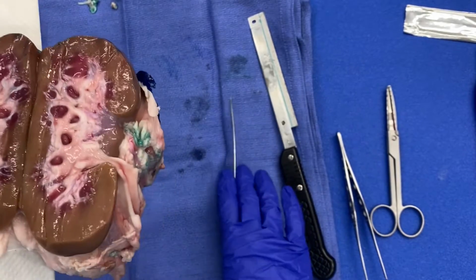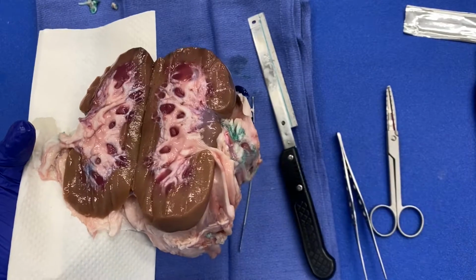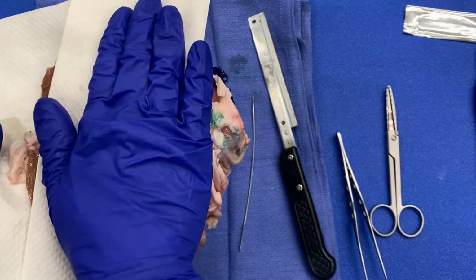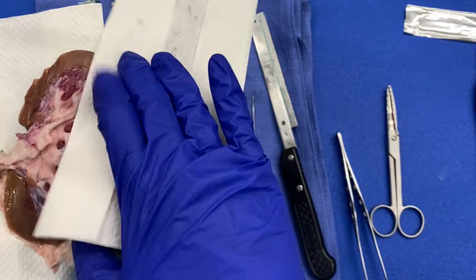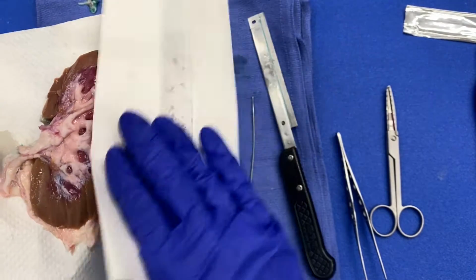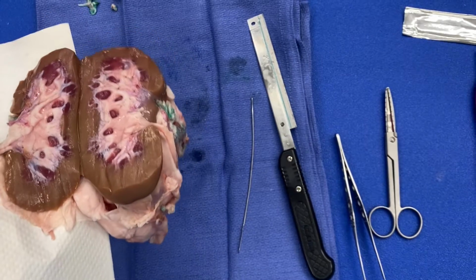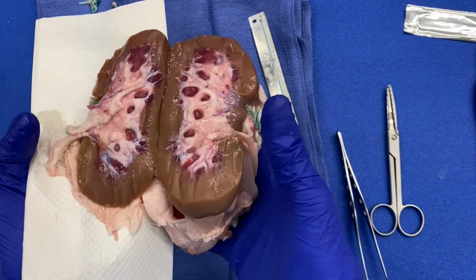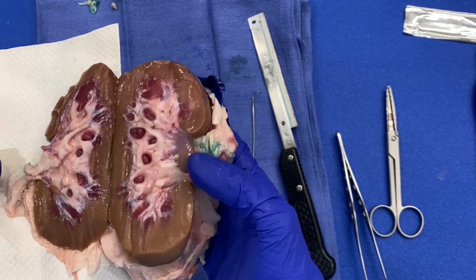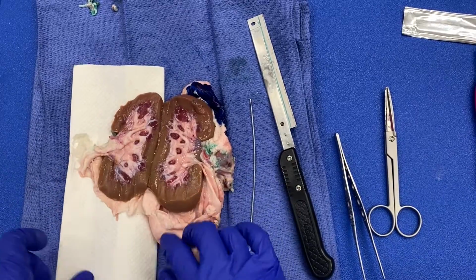Okay, so now at this point, once you've bivalved the kidney, what you can do is measure the kidney in 3 dimensions, because remember we had all that additional adipose tissue attached. And then at this point in the human specimen, you want to identify your adrenal gland as well. And this we don't remove. You never remove an adrenal gland in a human specimen prior to cutting open the specimen. All right.